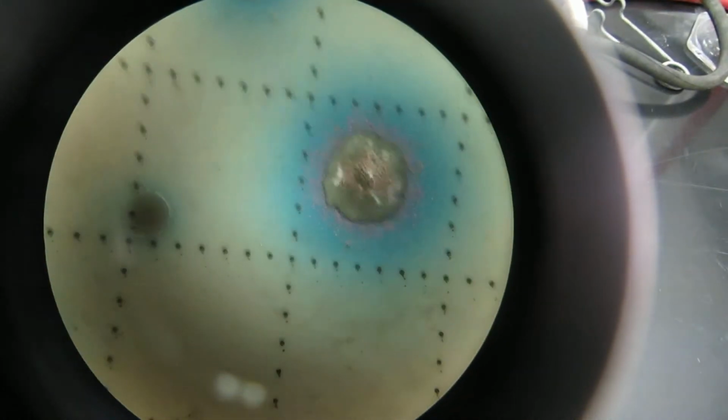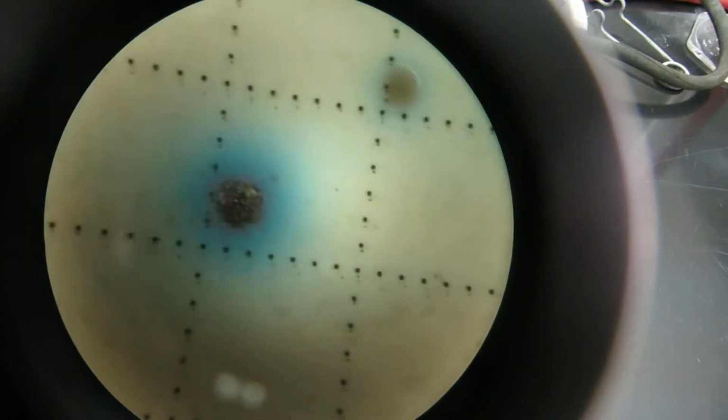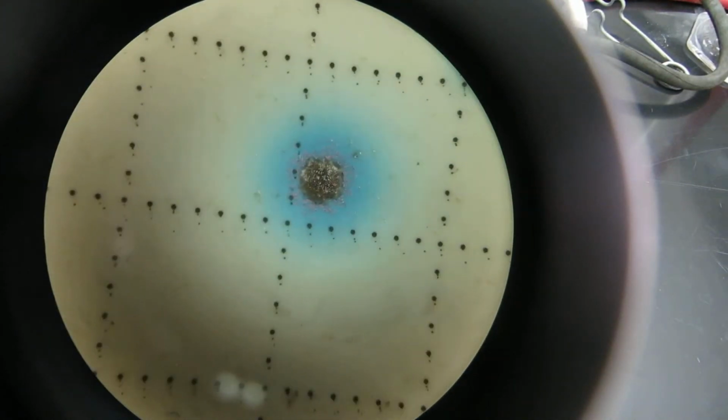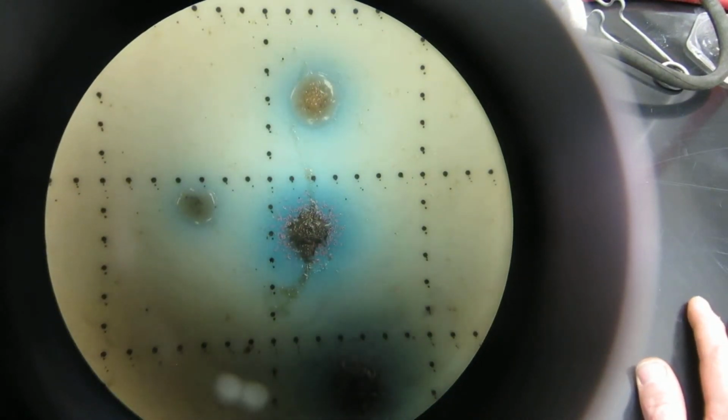So when you get the big ones, they start to get a little bit white in the middle. There's some good examples there. The smaller ones still look mostly blue because the blue halo comes out first, but when you let them grow too much, then they start to look a little bit white in the middle. Anyway, you count it as 1 if it's got the blue halo around it. So if it looks like a blue colony, then it's 1. So that's mEI, that's Enterococcus.